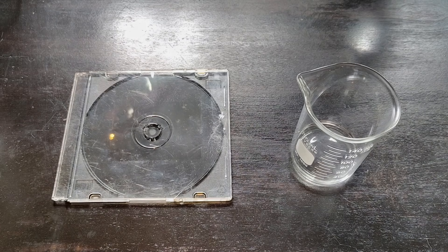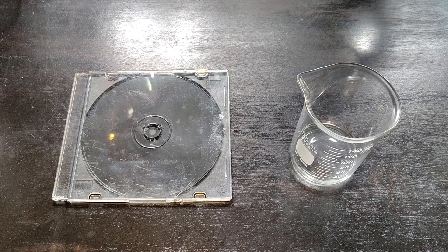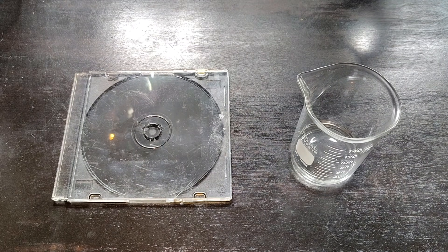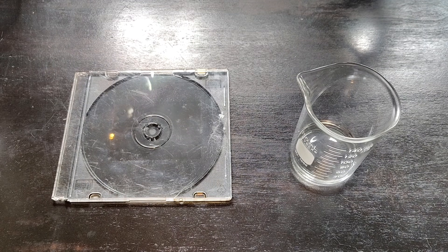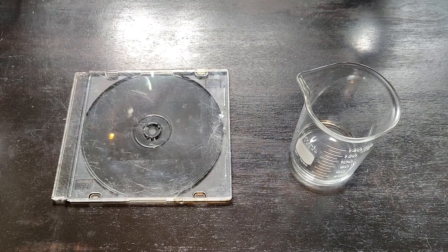In this video I'm going to show you how to make a proton exchange membrane that you can use in order to make a DIY fuel cell or a DIY electrolytic split cell.